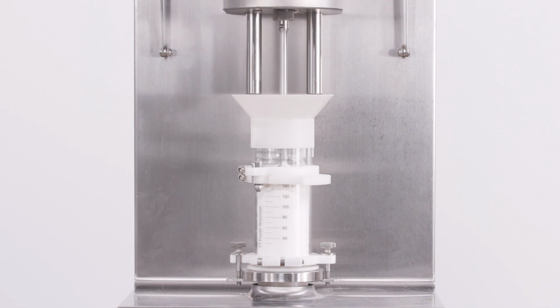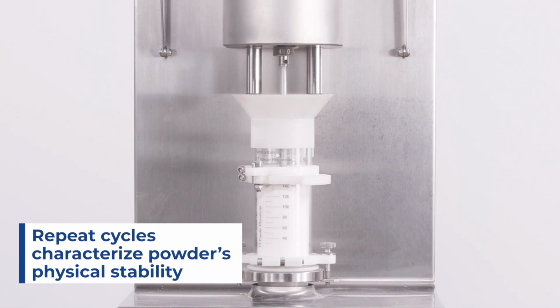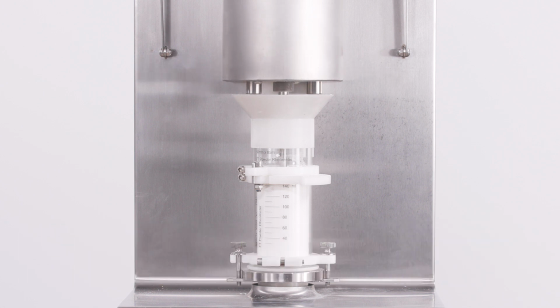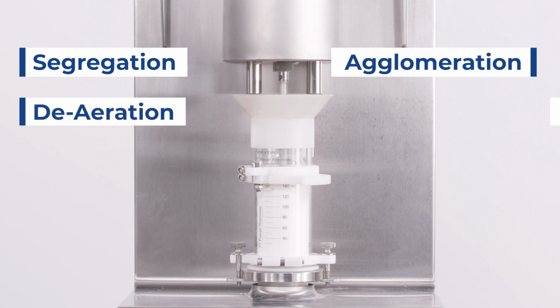By repeating multiple cycles of conditioning and testing the powder, we are going to characterize the powder's sensitivity to being tested in the FT4 and measure how its flow properties will change under those repeated test cycles. Doing so can help characterize certain powder processing phenomena such as segregation, deaeration, agglomeration, or attrition.